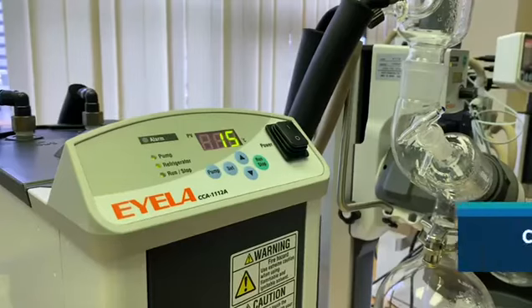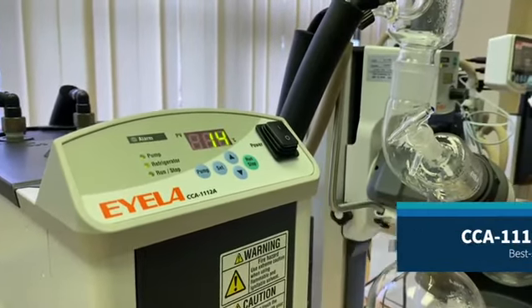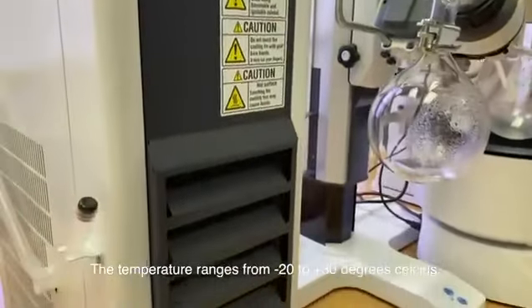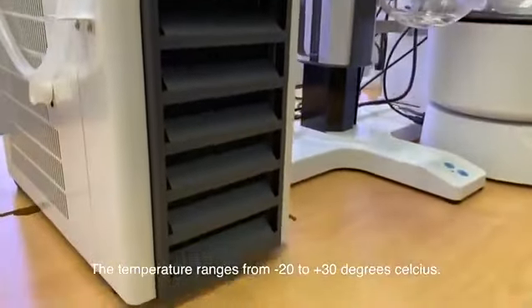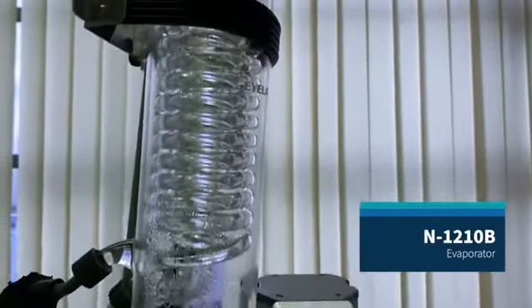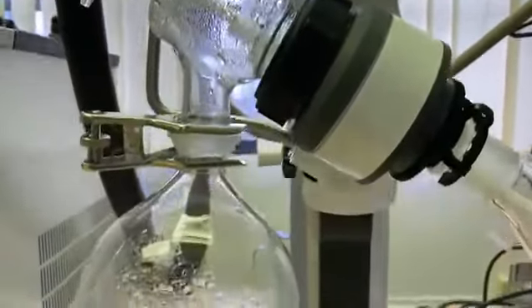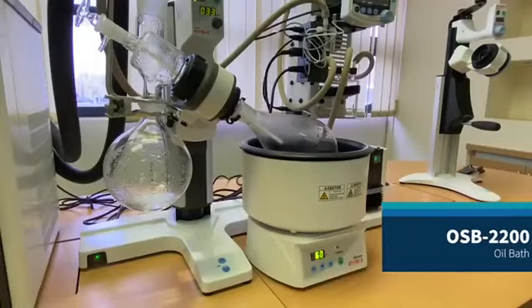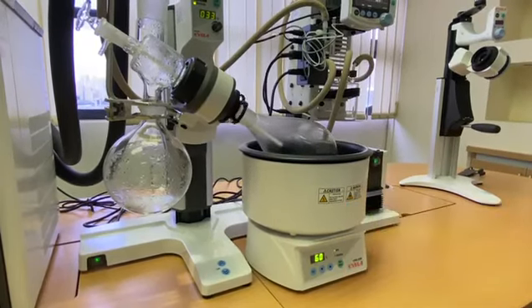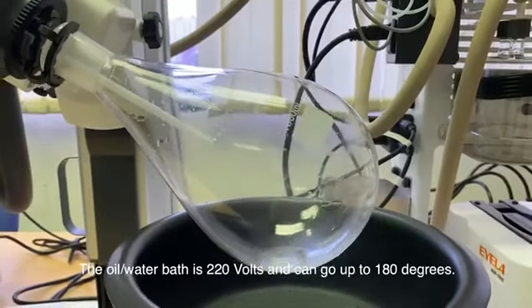This is the best-selling unit, CCA-1112ACE. The temperature ranges from -20 degrees to 30 degrees Celsius. This is the evaporator, also known as N-1210B. OSB-2200, the oil bath, is 220 volts and can go up to 180 degrees.